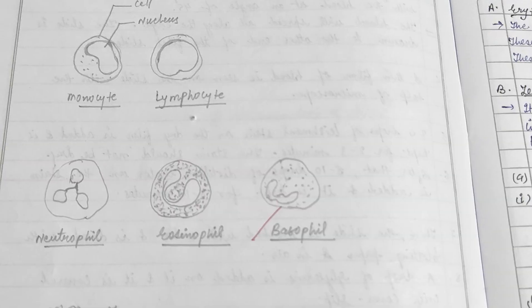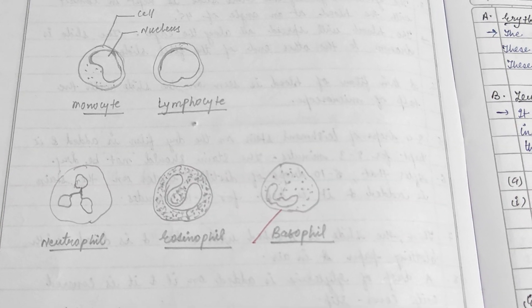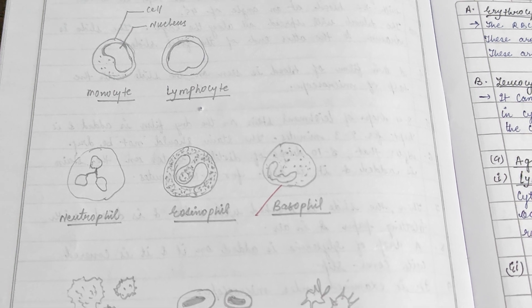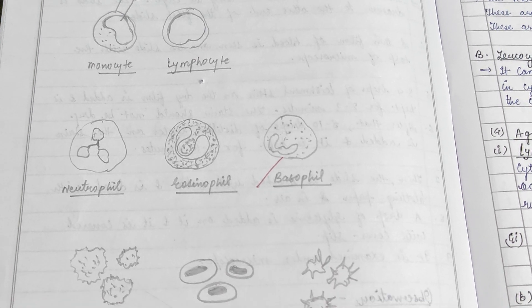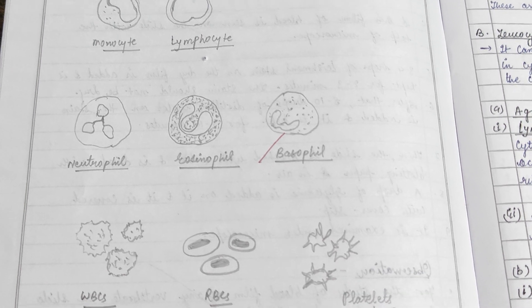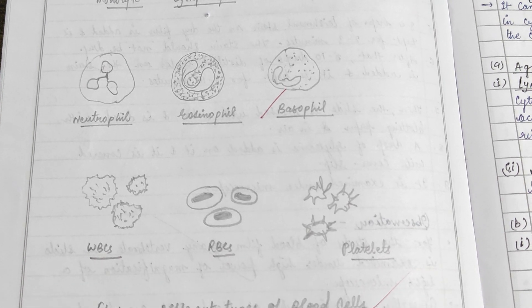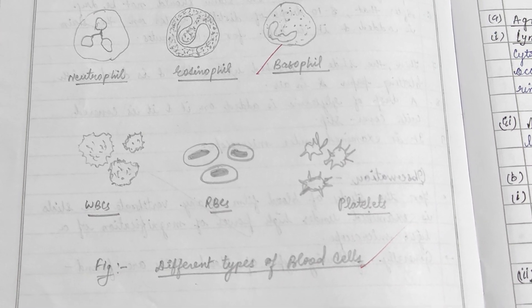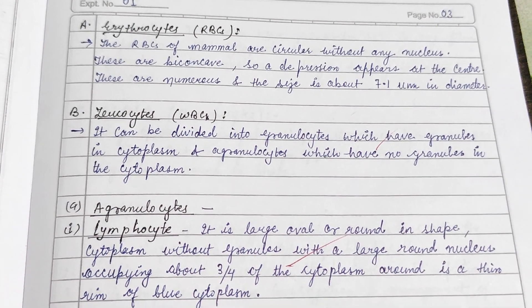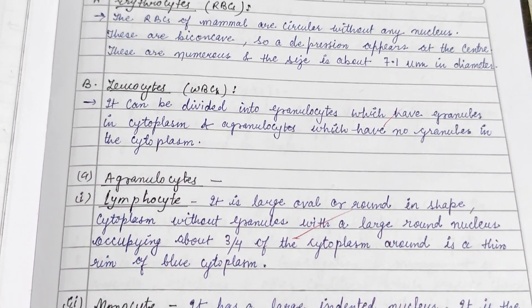Observations are as follows. We observe different types of blood cells: monocytes, which have a larger nucleus and are the largest cell of the WBC; lymphocytes; neutrophils; as well as RBC and platelets in the field.